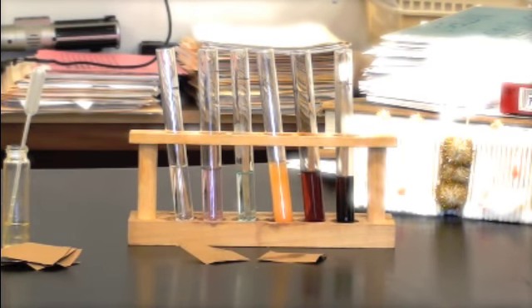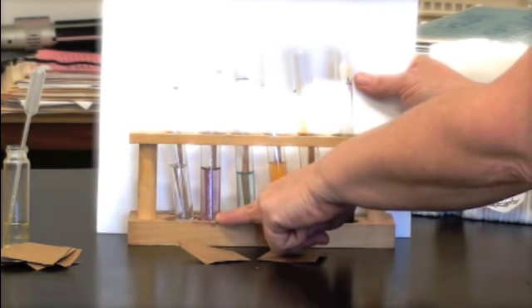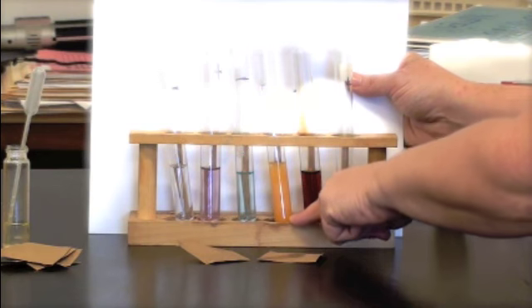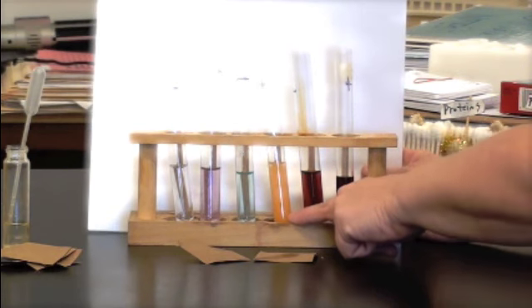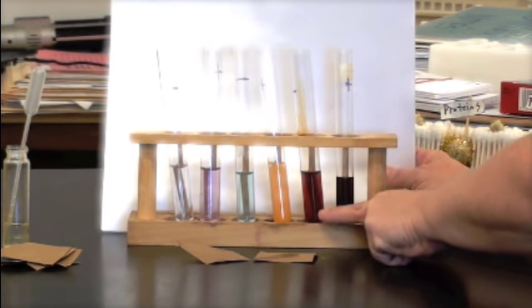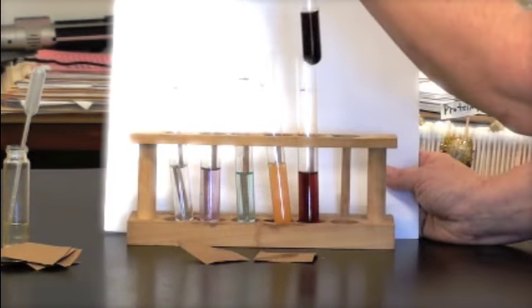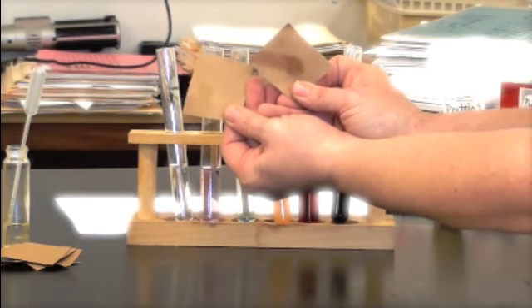The first goal of today's lab is to create a set of standards for each test. Here, the protein test, negative control, positive control, Biuret protein turns lavender. Here, the negative control and positive control for the simple sugar, that was the corn syrup test. This is the negative, this is the positive. The positive and negative control for the starch test, since clear and brown is what the reagent normally looks like, and in the presence of starch it turns black. Then for the fat test, you can tell which one looks like a greasy French fry bag, can't you?